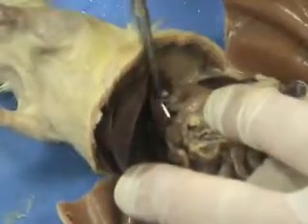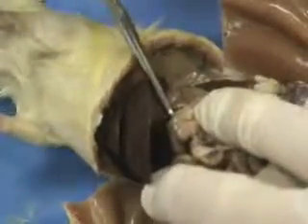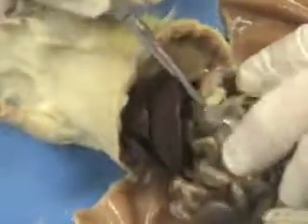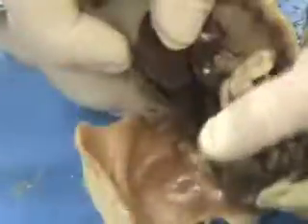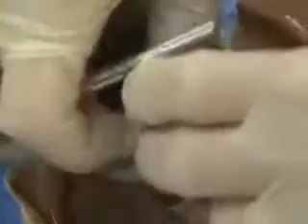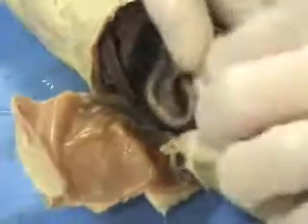Just like at the posterior end of the stomach, we've got a sphincter that leads right up to the small intestine. That small intestine, if I open this up a little bit more, starts at the stomach and works its way around. So a lot of this material here is small intestine. And remember, we said the small intestine isn't necessarily so short, it's just small in terms of diameter.